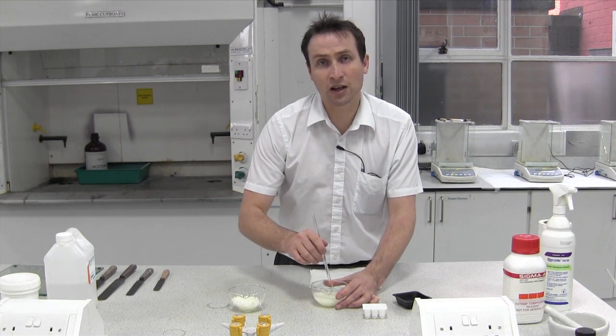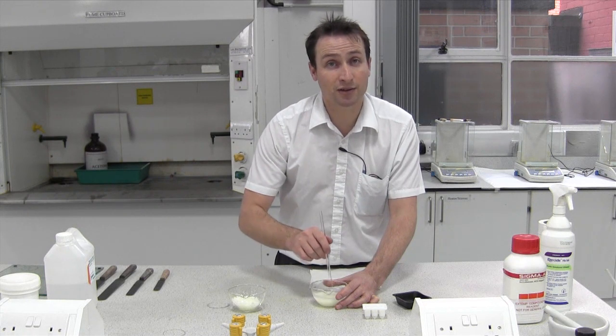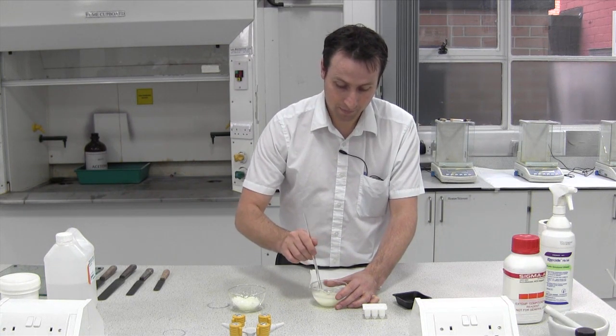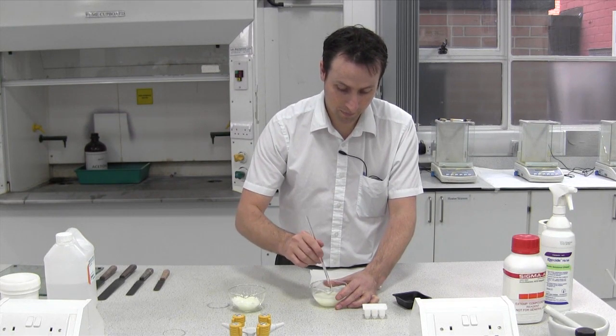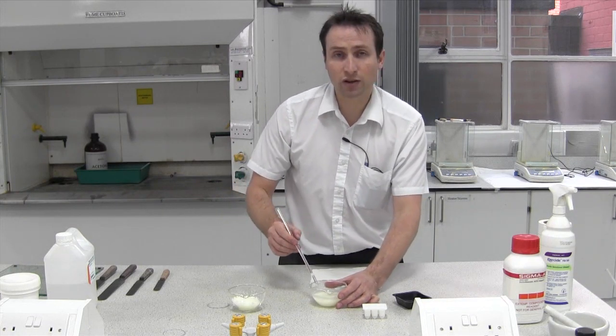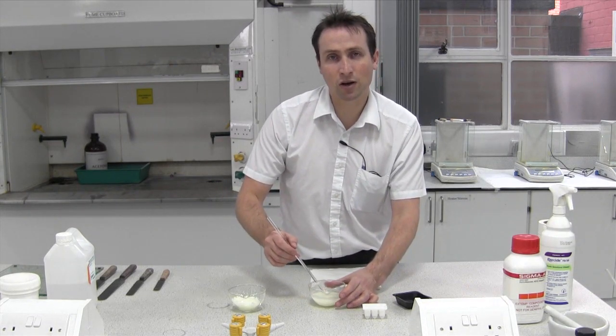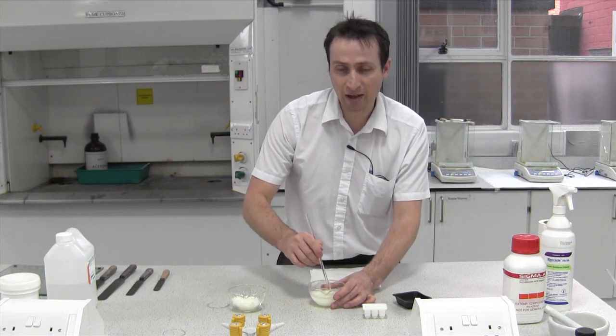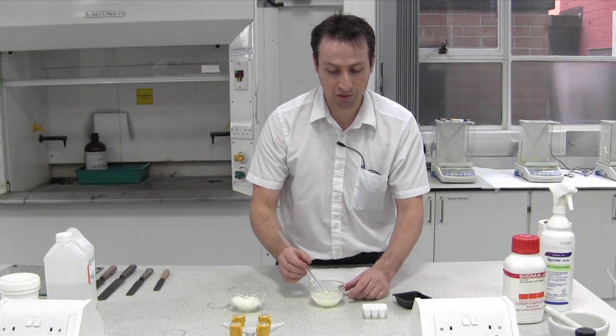So this in practice will probably take 5 to 10 minutes. We're now going to show you the next step slightly ahead of time — this is not quite cooled to exactly what we would like — but we're now going to pour them into our suppository moulds just here.